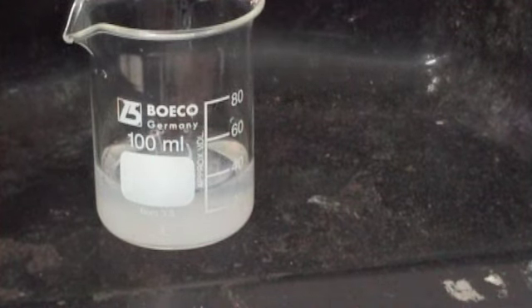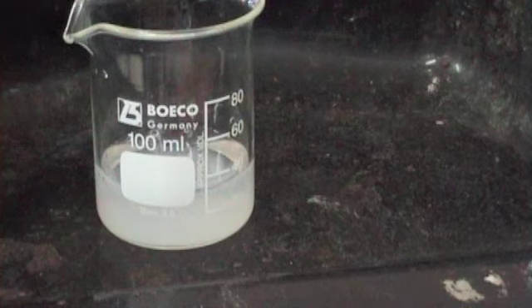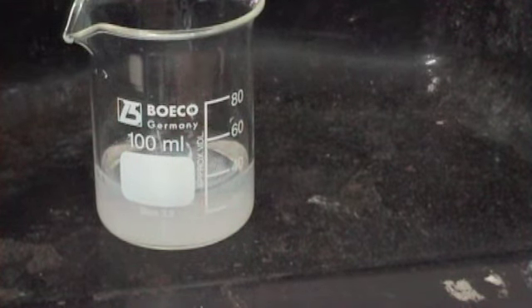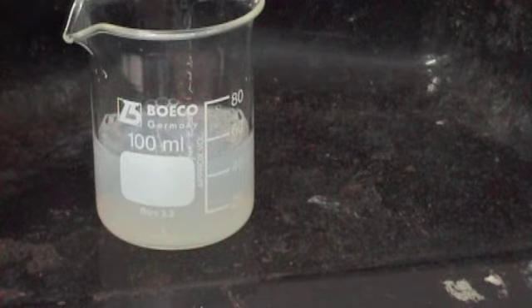Okay. So there it is, it's a white ppt. What is the white ppt? Name. Magnesium hydroxide. Okay, and in theory, nothing should change if I add extra, okay? There's extra, nothing's happening, okay?